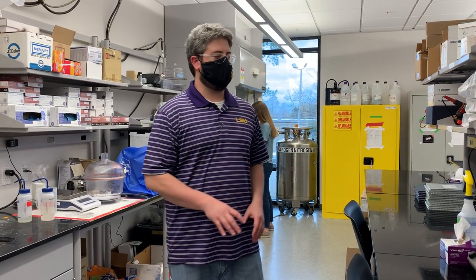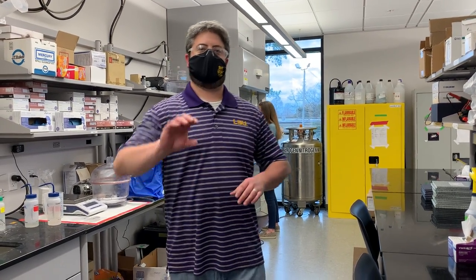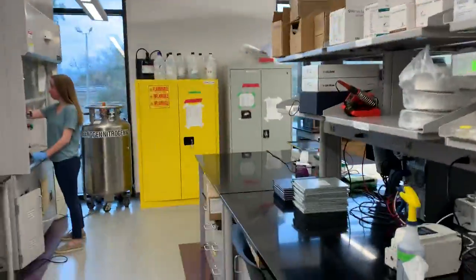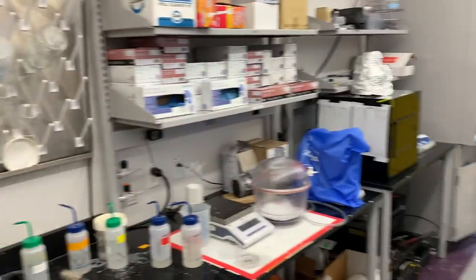We also have projects related to algae as well as biofilms. I'm going to take you through the lab today and show you some of the different technologies we use and some of the stuff we're developing. So let's get started with the guided tour. Alright, so we start over here — here is the lab.